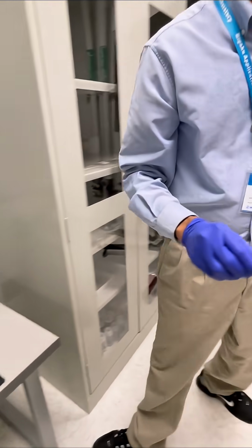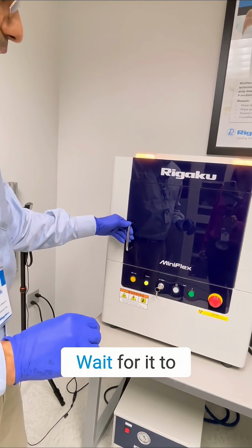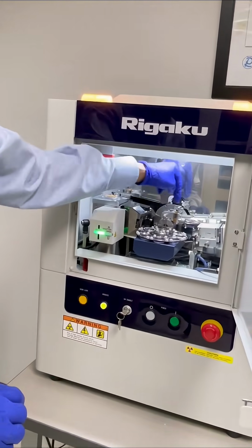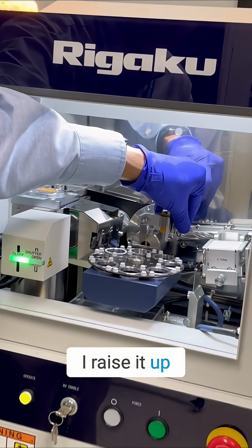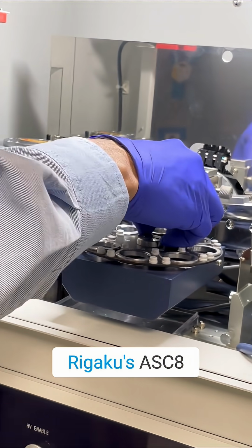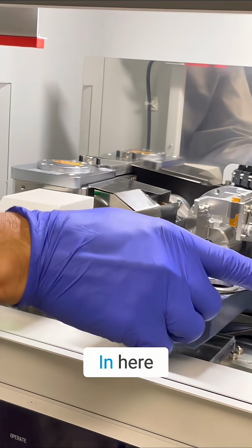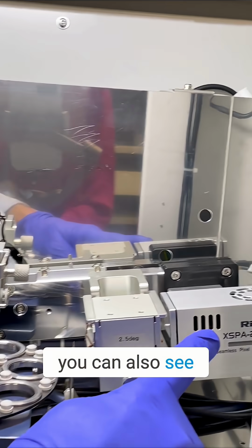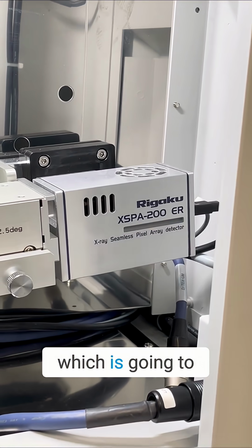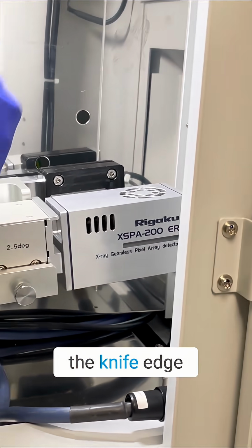So that's the sample. We are going to open the door lock button here and wait for it to flash. And the knife edge, I raise it up to put the sample on the sample changer, also known as Rigaku's ASC8, Auto Sample Changer 8. And here you can also see the XSPA-200 ER detector, the pixel array detector, which is going to give us excellent data on this sample. I'm going to lower the knife edge.